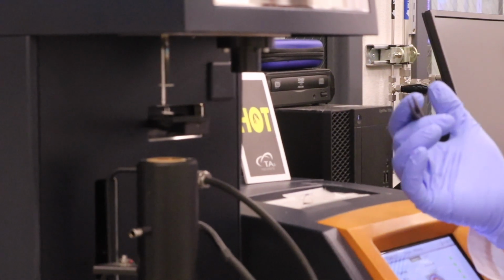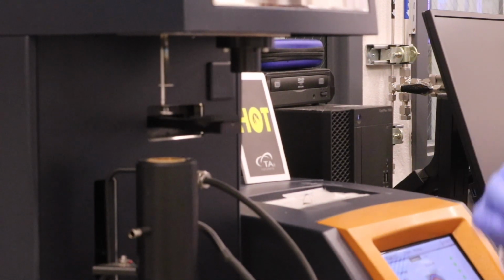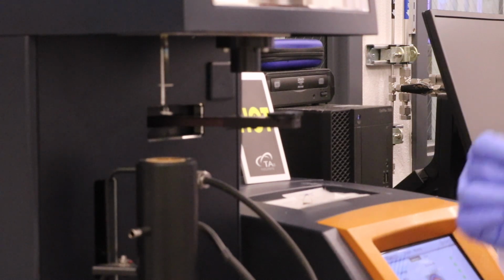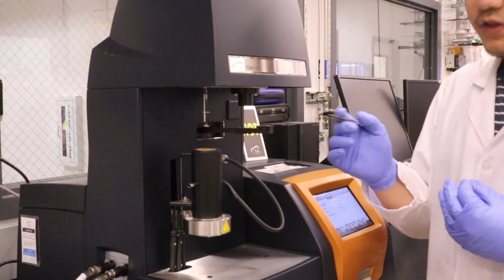So if you have a material of one polymer and one metal, at a lower temperature the polymer will first degrade, and then the weight you measure will be the amount of metal you have. In that way, we will know the exact composition of this sample.